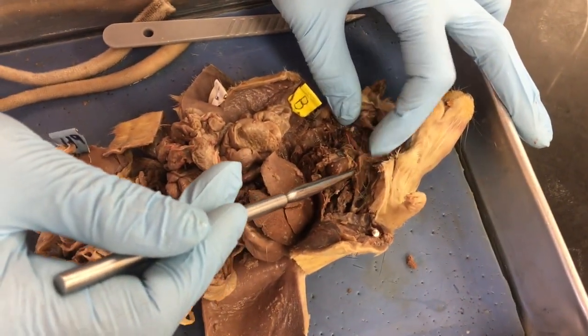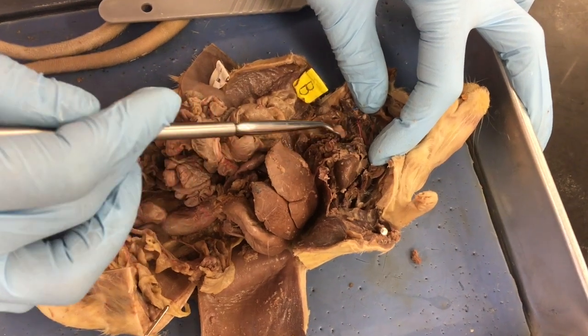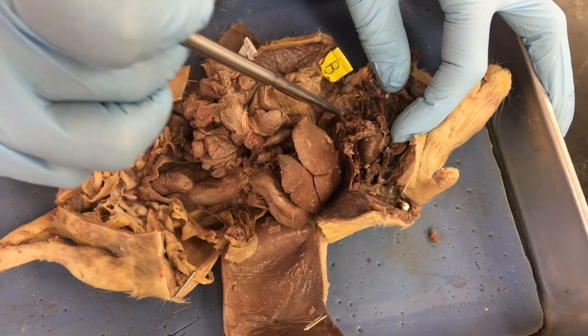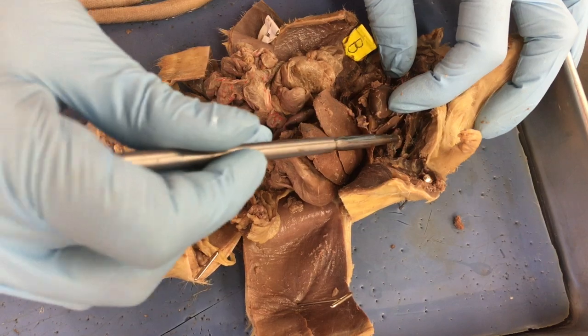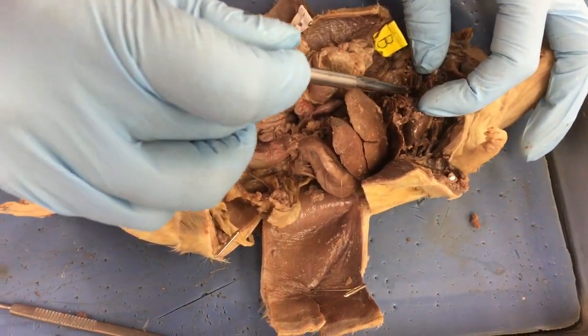So you have your thymus gland on top of the heart. And then over here to the left and right, we have lung lobes. There's a lot of gooiness coming out of there. Just ignore that gooiness and wiping that off. So there's some lung over there, and over here, there's some more lung. So there's lung and there's lung.